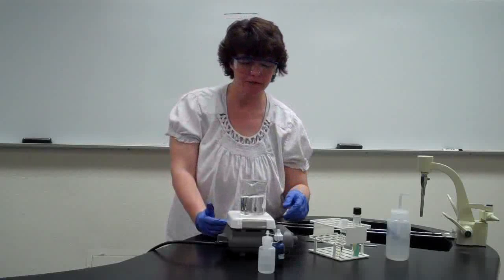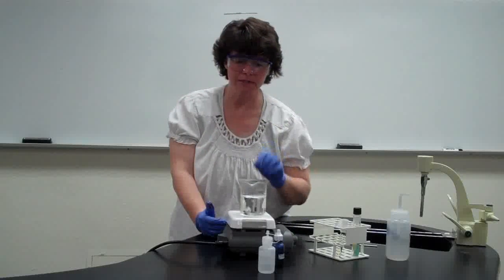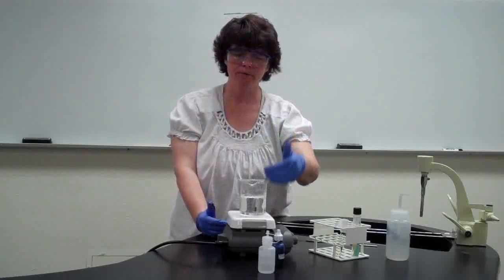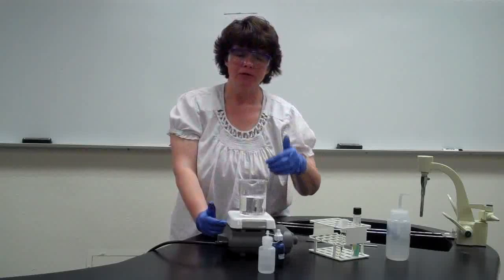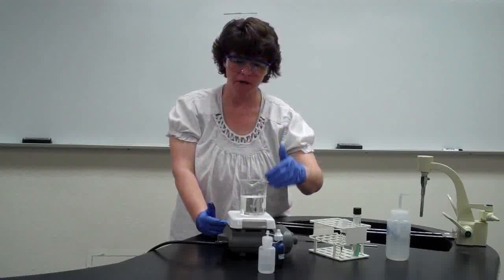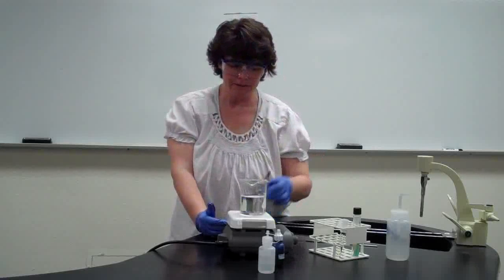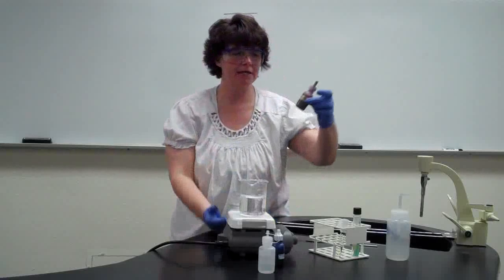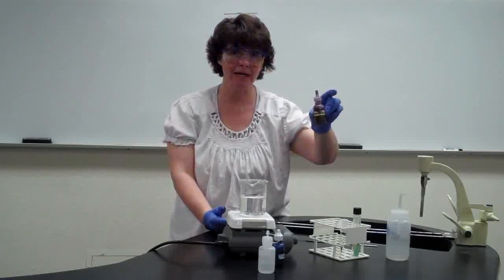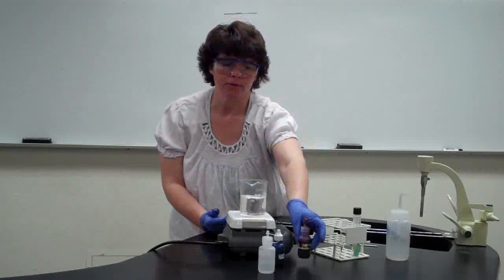We have to clean the beakers, and it's a little difficult when they have too much stain in them. So that's the first change we're making. We're going to actually put the slide on the boiling water bath to steam it so that it allows the carbol fuchsin to penetrate the wall. So that being said, our first stain in the acid-fast is the carbol fuchsin. So now you're noticing we're using a red stain as our primary stain as opposed to the purple one of the gram stain.